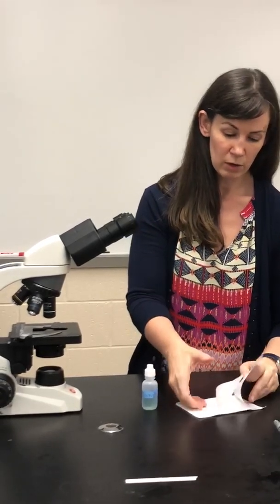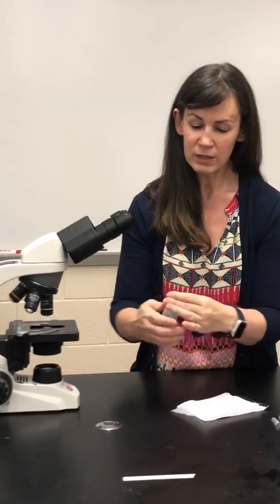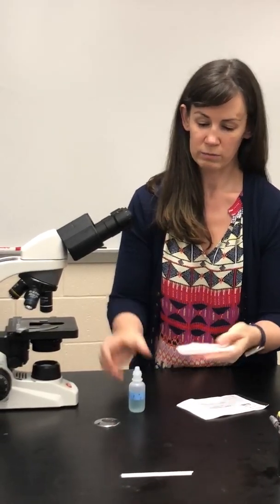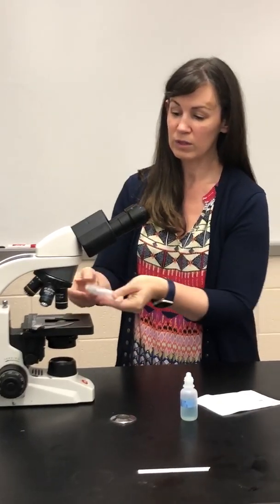To clean your microscope, pull out a full piece of lens paper and fully saturate a portion of it with the lens cleaner. You want to get it really, really well saturated. And then you're going to use that to clean the bottom of the objective, making sure that you are pushing up into that objective when you are cleaning the objective. These things can get really, really oily, and you want to make sure that you get them very clean because that oil can make them hard to see through.